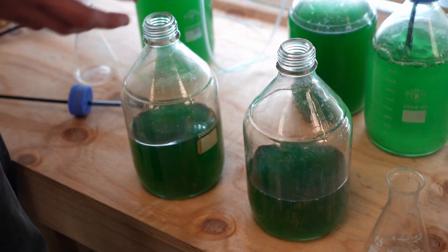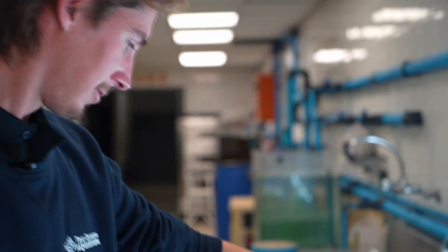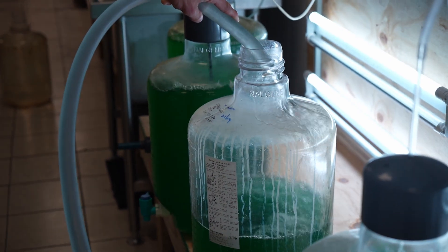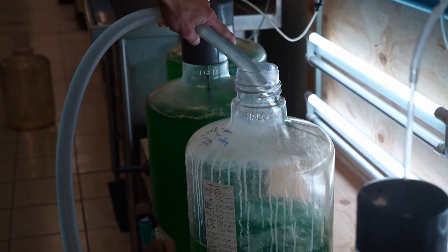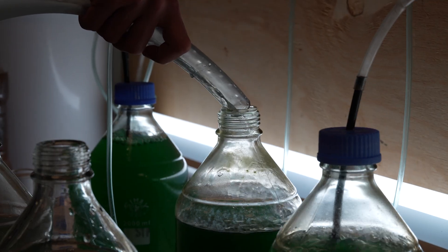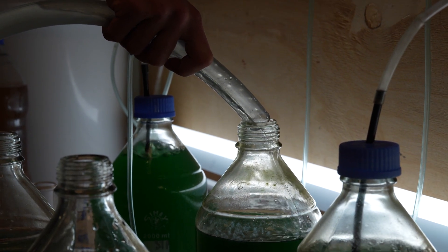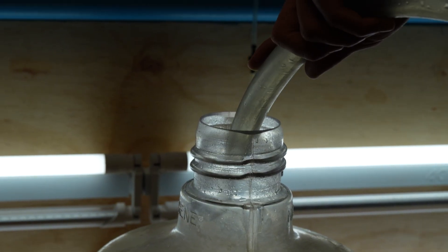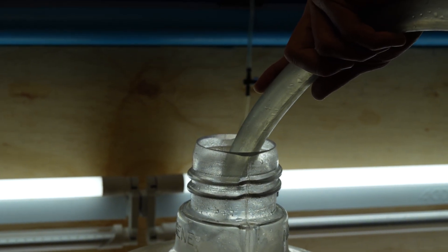But now we've got a half drum of green water and obviously that's no good to us. So we're going to want to re-top that up, restock that. And so how we do that is we use just seawater, but it's filtered and purified seawater. We run it through some micron filters and then also through a UV filter, just so that any contaminants are killed, so it's very pure water when you put it in here.